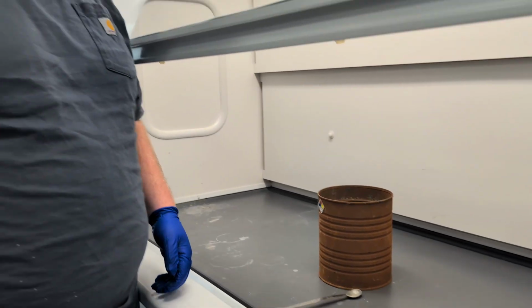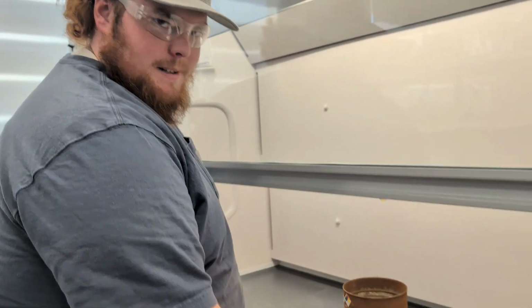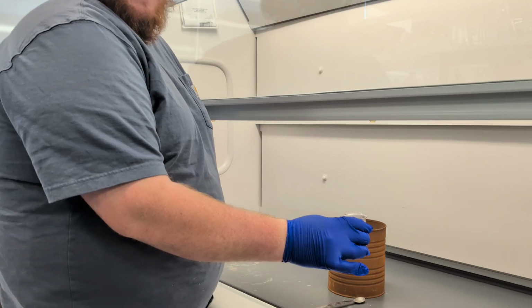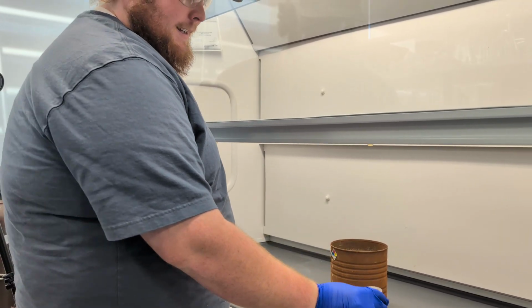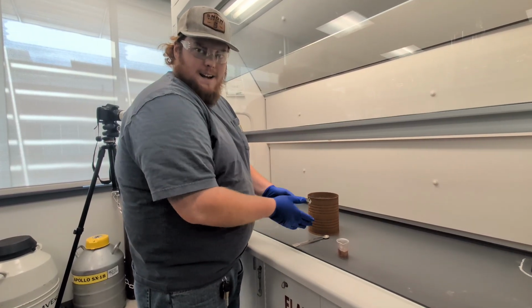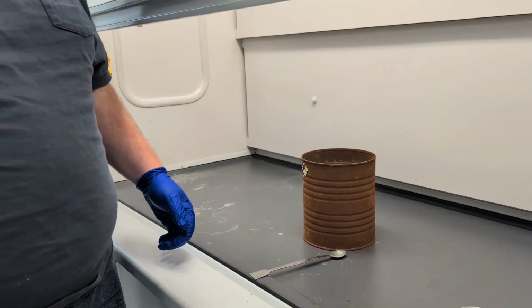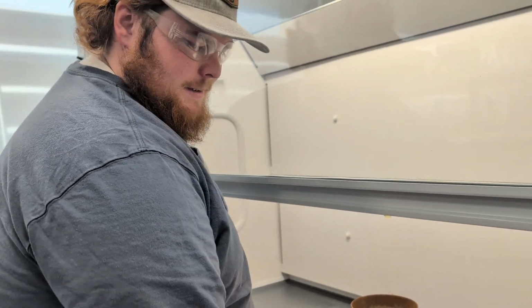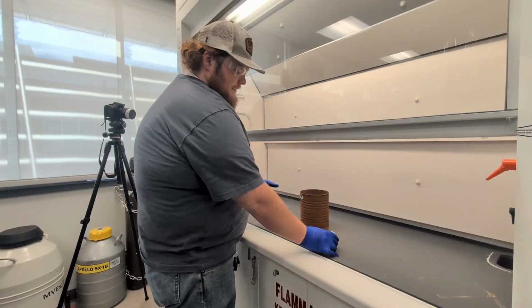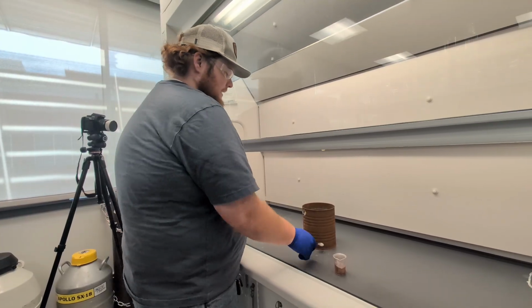Professor Breakall helped me set up this reaction, so thank you to him for that. In our case, we didn't use magnesium or sparklers. We used a starting mix of potassium permanganate and glycerol, which will spontaneously ignite and set off our thermite mix. Okay, so this is a mix of aluminum and iron oxide. Currently there's not enough energy to activate it, even though it is spontaneous.